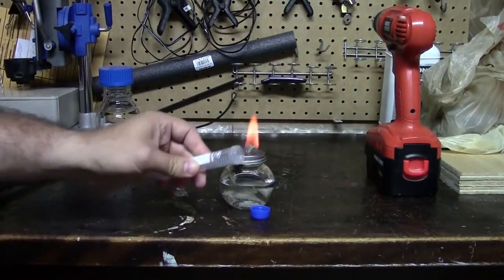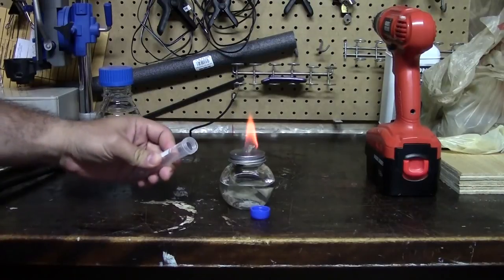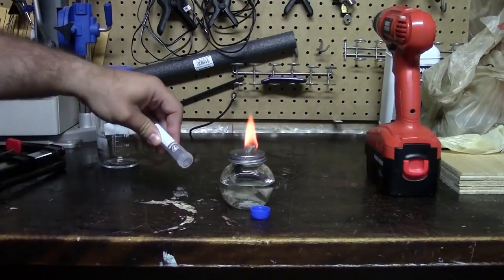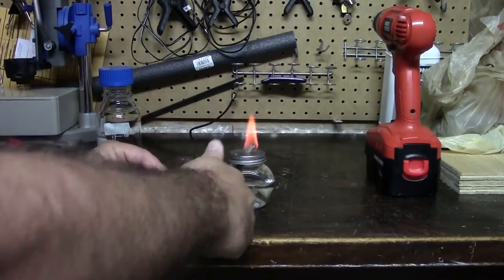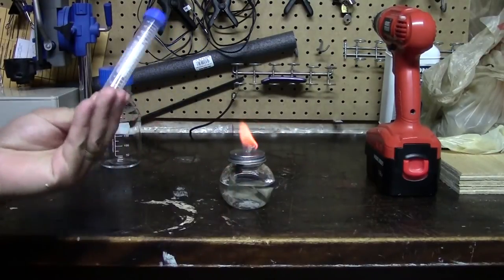I can also use the flame to very briefly clean the edge of the tube for pouring things out, and do the same thing with the lid. Put it back on. And that allows me now to keep my tube sterile.